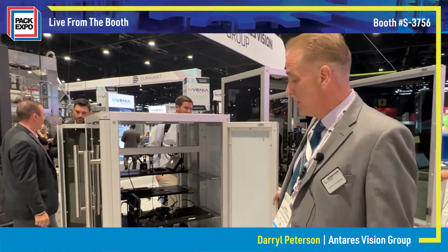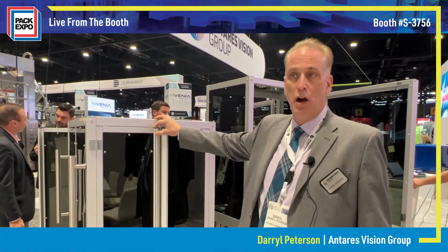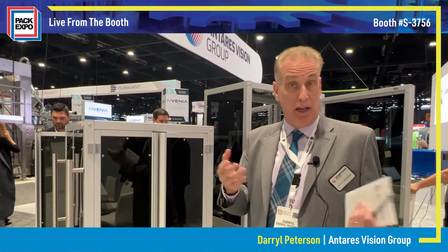This whole system was originally meant to be internal for our company, which is located in Parma, Italy, as well as our headquarters in the US, which is in Mount Laurel, New Jersey. It was meant for us to set up lab environments where we can do feasibility studies for customers. They'll send us their vials, their products, their syringes, different containers, and we can set them up in the system and do a feasibility study to determine the capability of automated inspection, what works, what doesn't work.